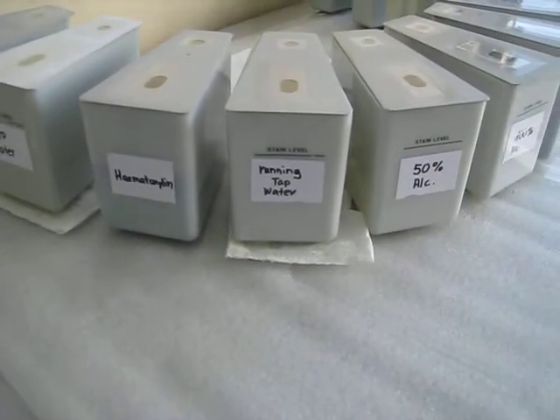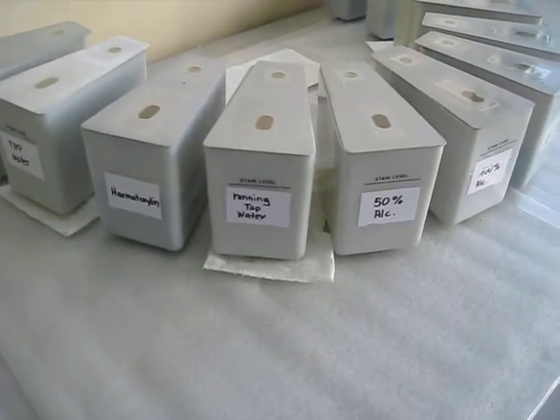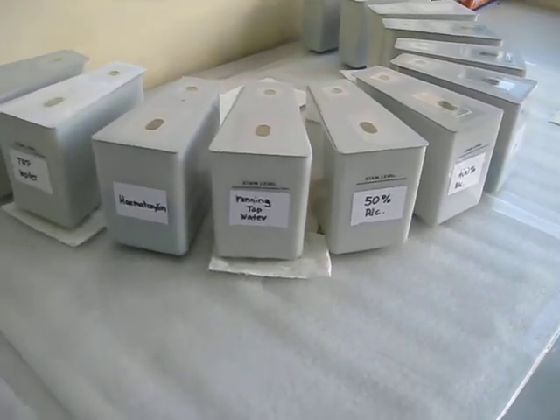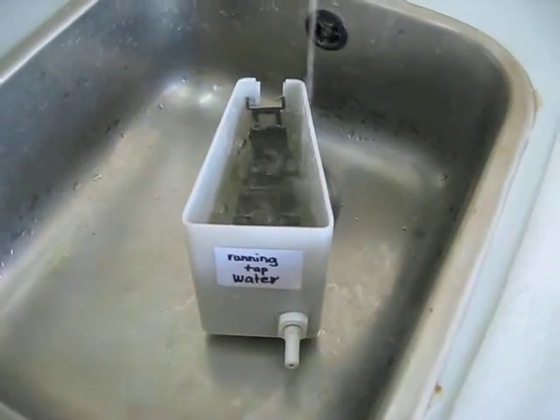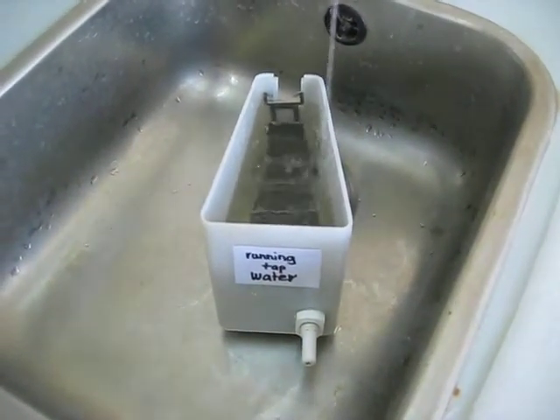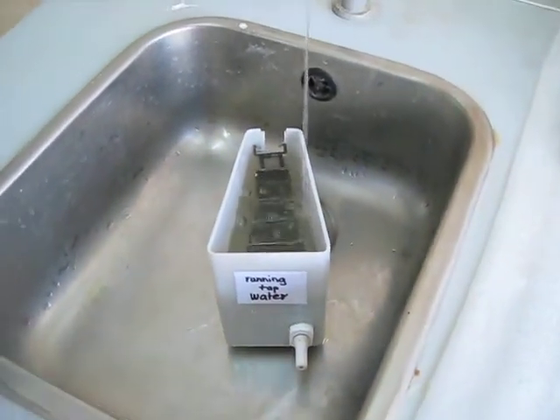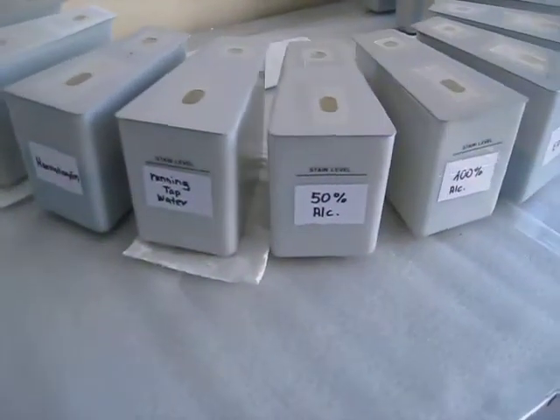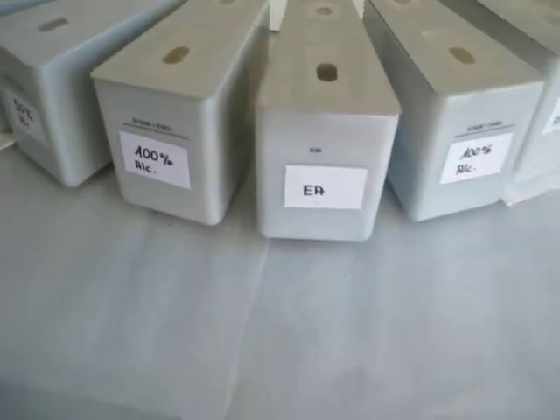Then you go to running tap water again, and this is the bluing process. You have a receptacle with running tap water and you keep doing it until the water runs clear with the slides in it. This is very convenient — you just use regular tap water. Then you have 50% alcohol and a change of 100% alcohol.